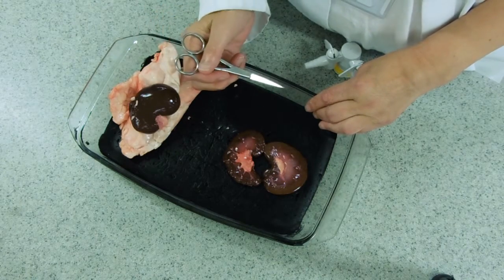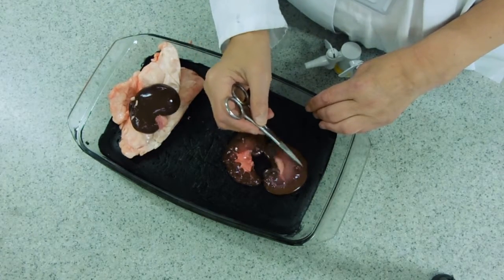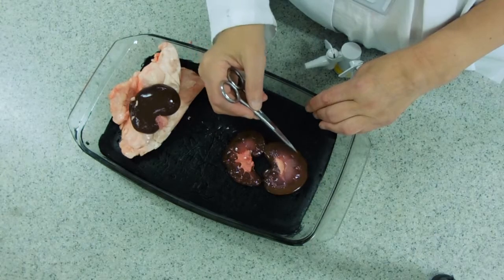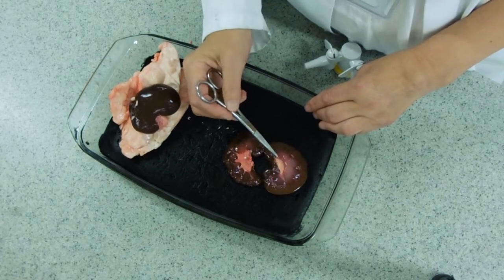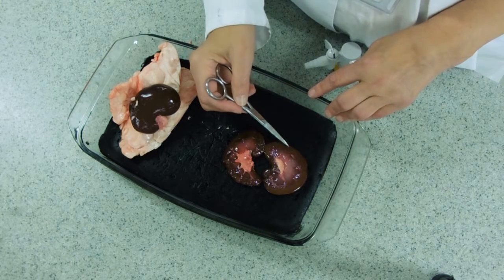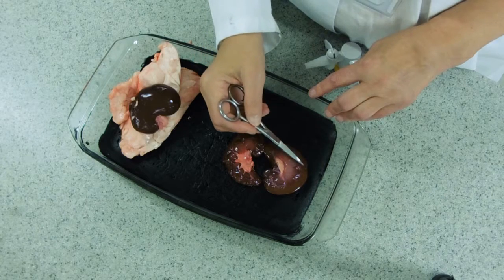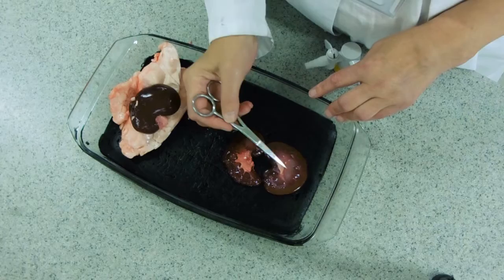When you watch the video for gross structure of the kidney, you'll realise that what's going on up here is that you've got a really good capillary network. You've got lots of little wiggly, windy tubes — the proximal and distal convoluted tubules — and you've got the glomeruli, and it all gives it this sort of texture compared with the medulla, which is far more solid.